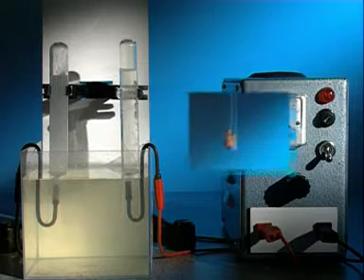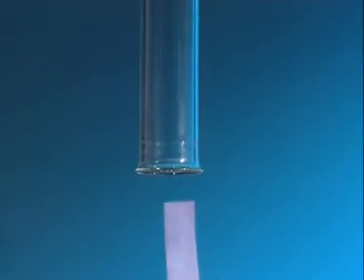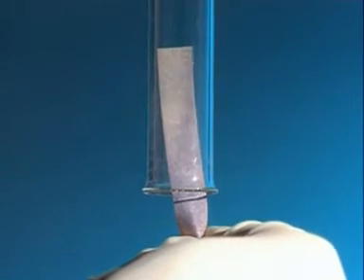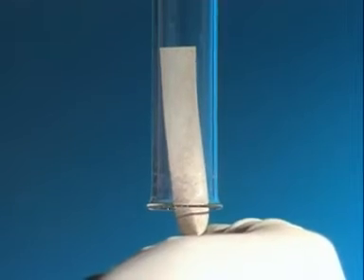The gas collecting at the positive electrode is tested with damp blue litmus paper. It goes red and quickly bleaches white. The gas is chlorine.